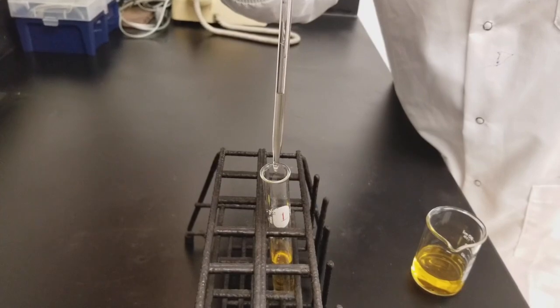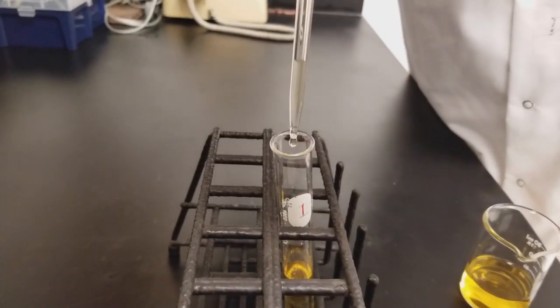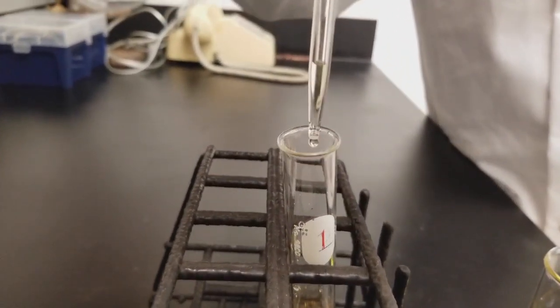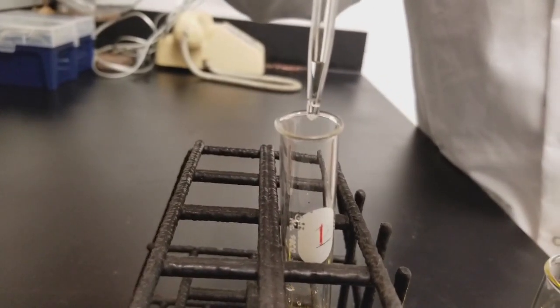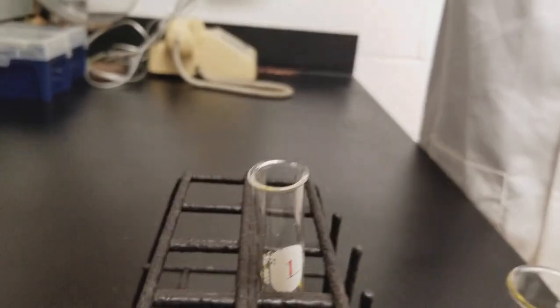Let the solution drain. You might notice there's still a little bit of liquid in the tip of the pipette. You don't have to worry about getting that out.